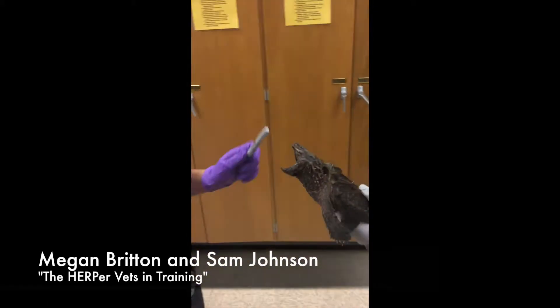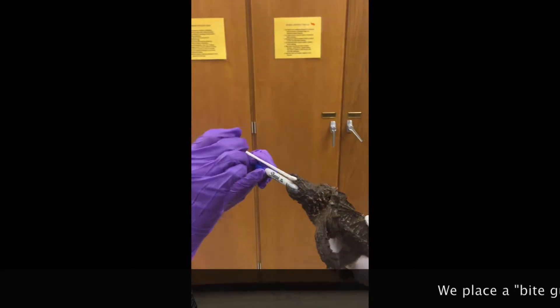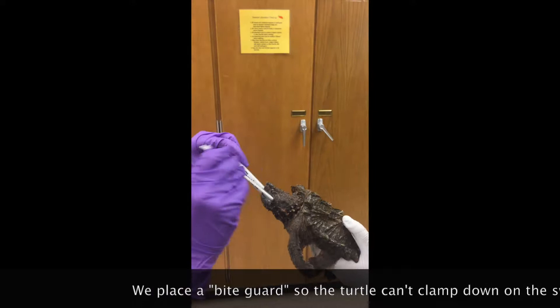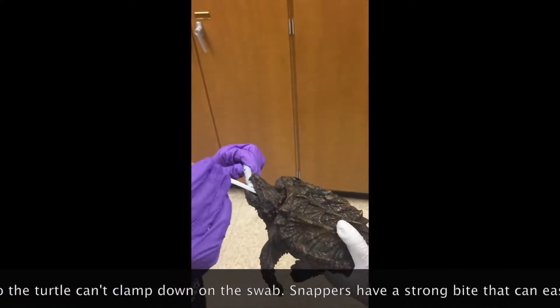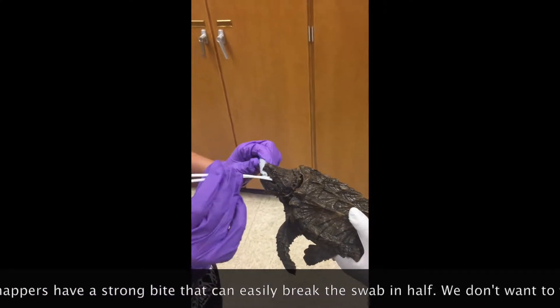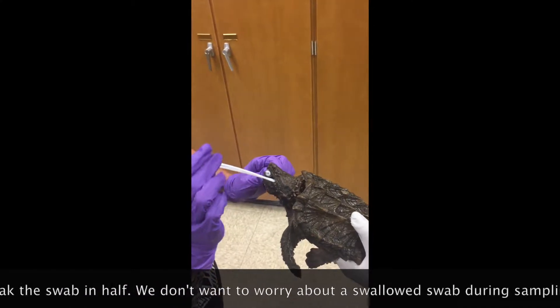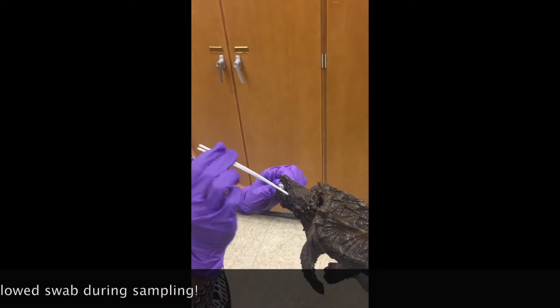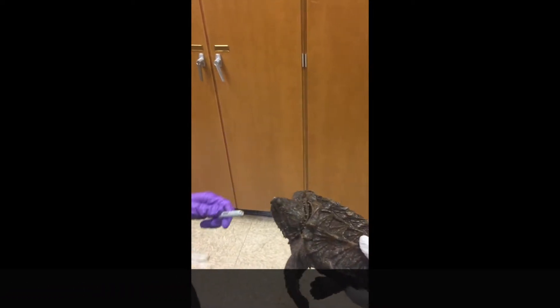So we're going to use a mouth guard marker to get him to bite onto so we can get in there with the swabs. Certain pathogens are usually respiratory, and then other ones can be GI, which is why we take swabs from both ends.